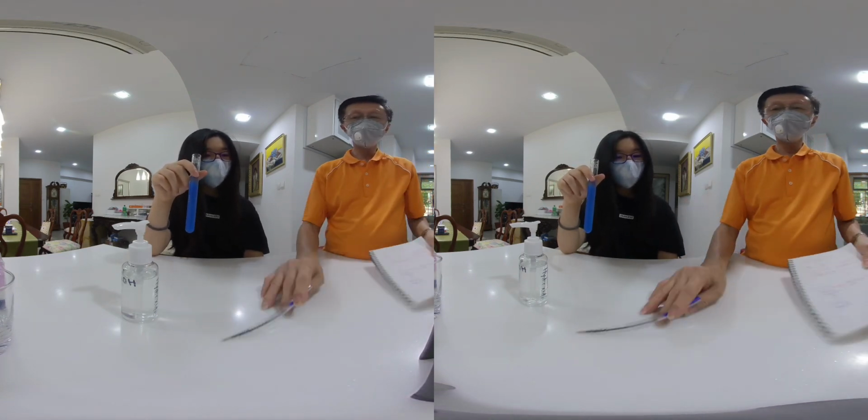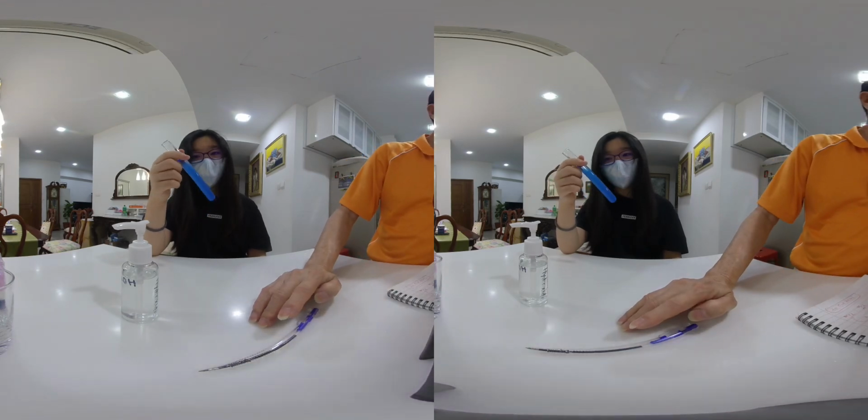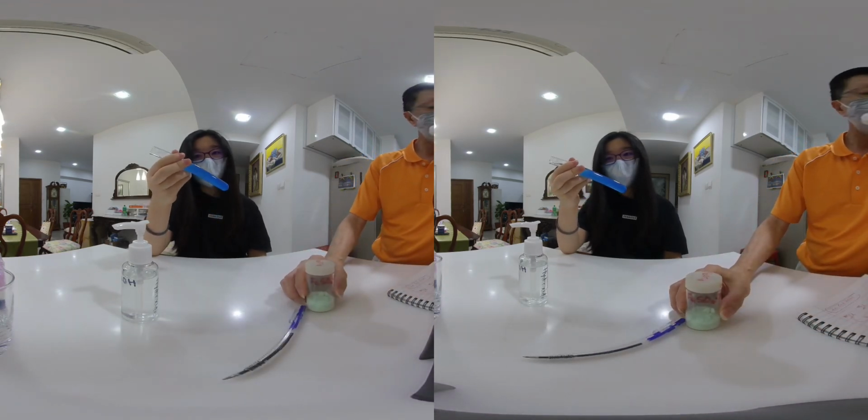What we want to do now, we will do another limiting reagent.